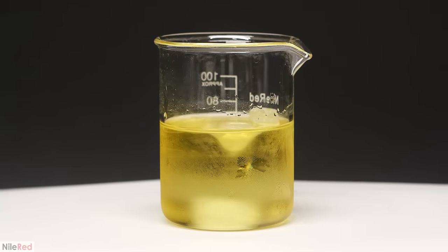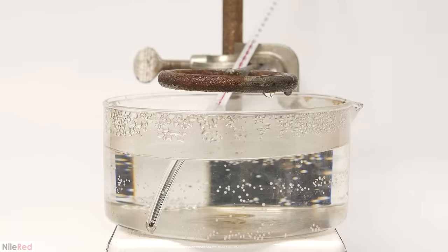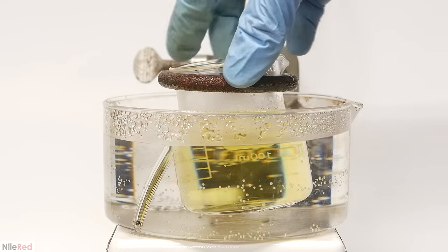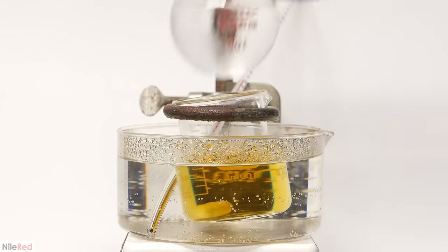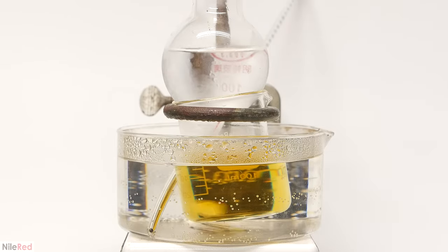Based on my pH papers, it all seemed to be good, but they aren't exactly super accurate, so I guess we'll see. The entire beaker was then put in a water bath at around 60°C. After sitting there for about 15 minutes though, I was concerned that too much ethanol would evaporate off, so I put a flask with cold water on top of it.